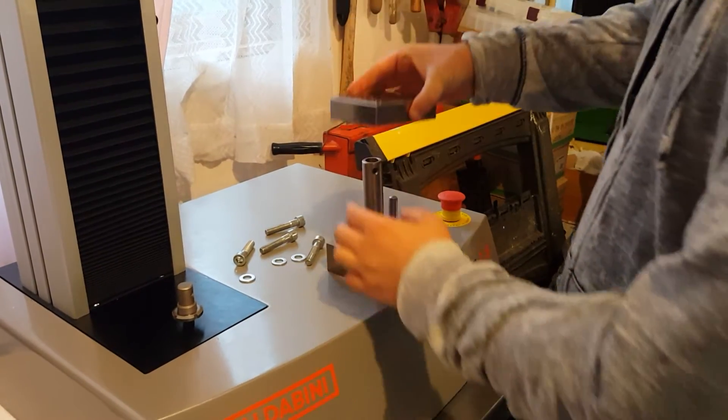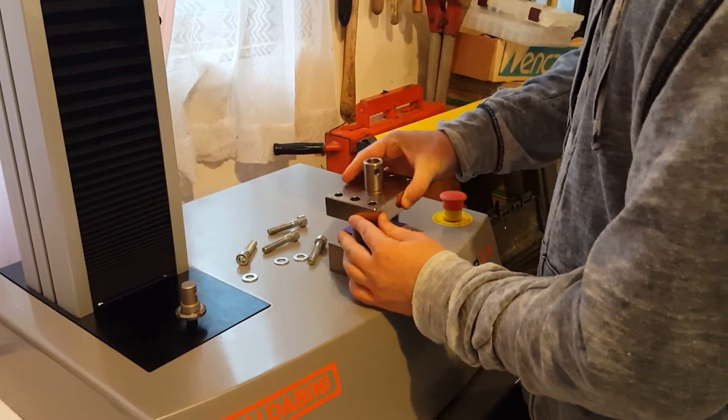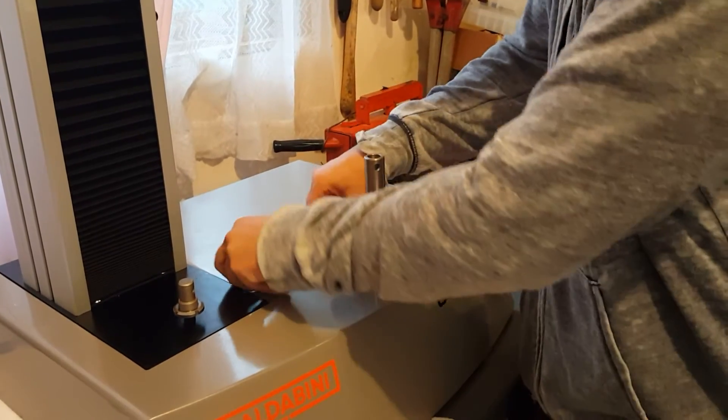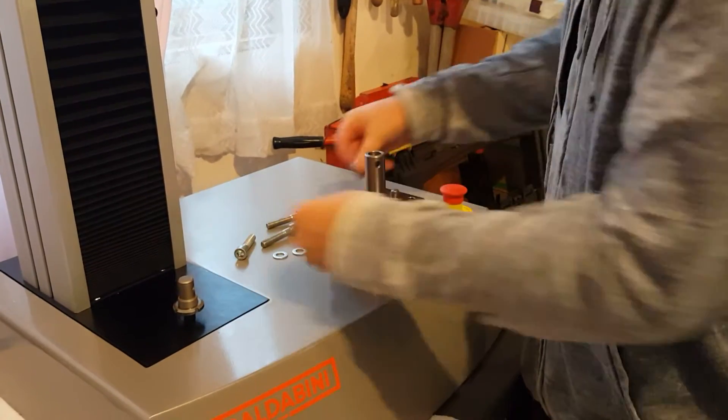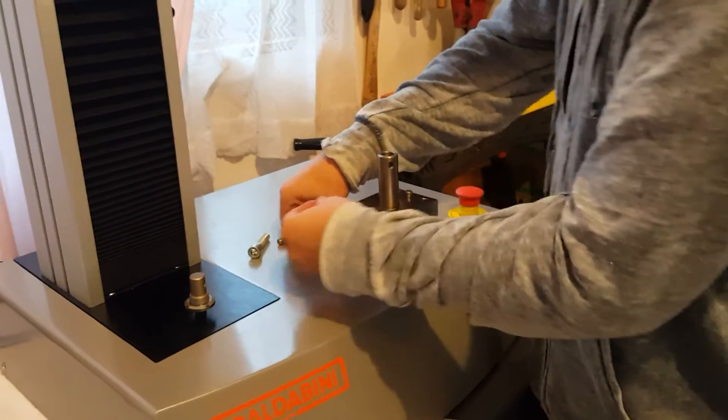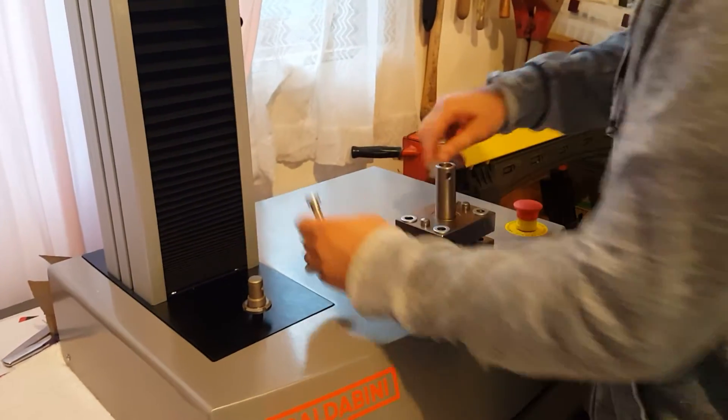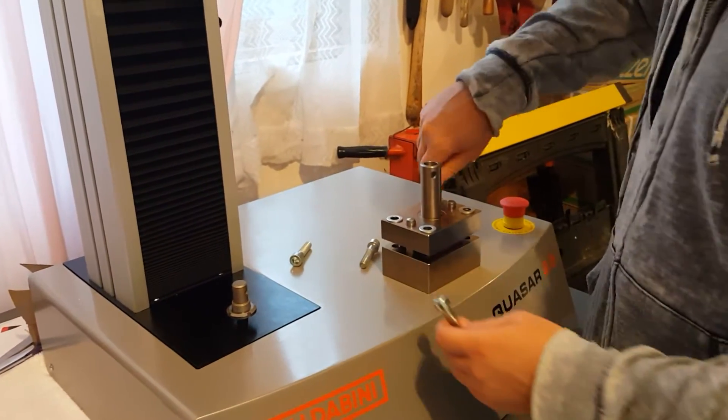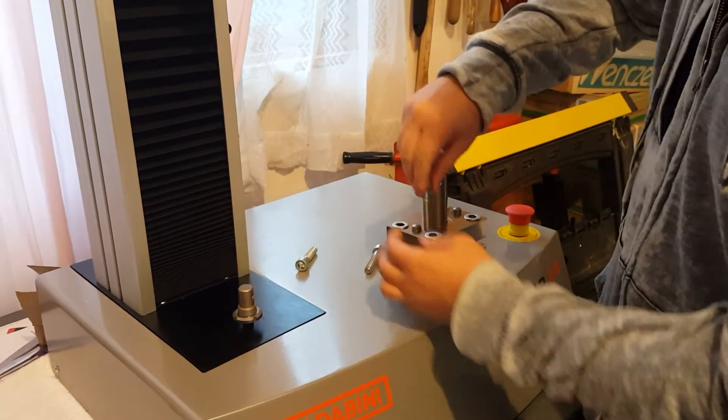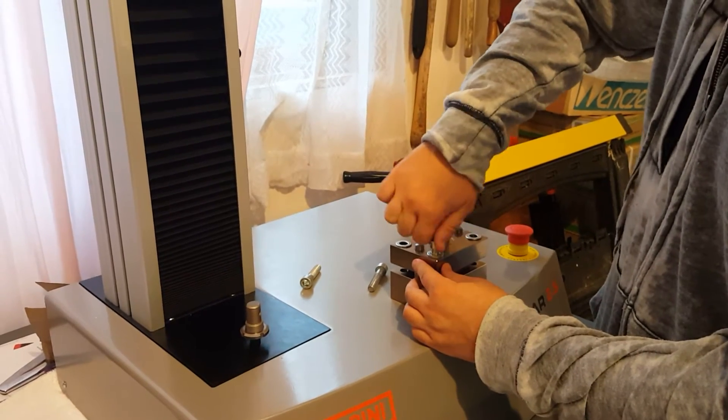Now we want to come with the top. Put the top on just like that. We have our washers and our four set screws. We'll go ahead and tighten those.